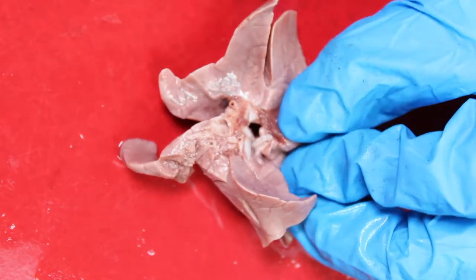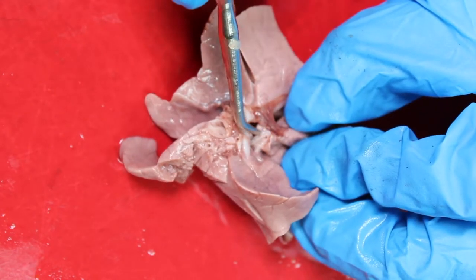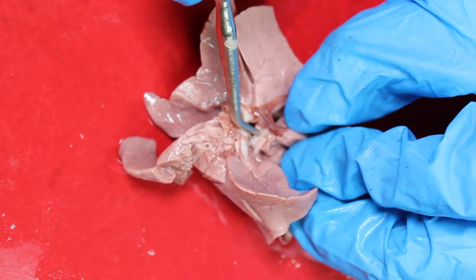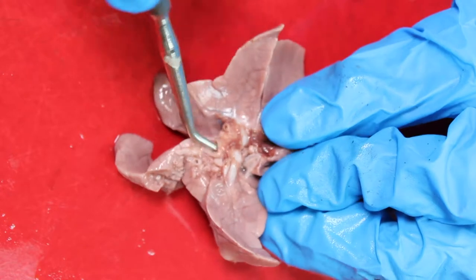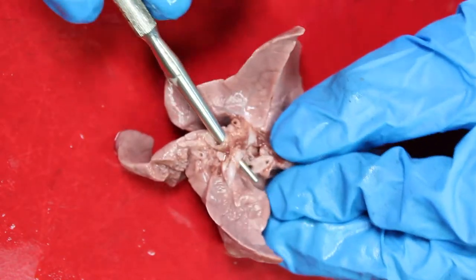This is a ciliated epithelium interspersed with goblet cells, which produce mucus, and club cells with actions similar to macrophages.